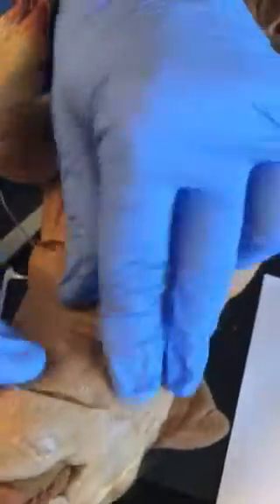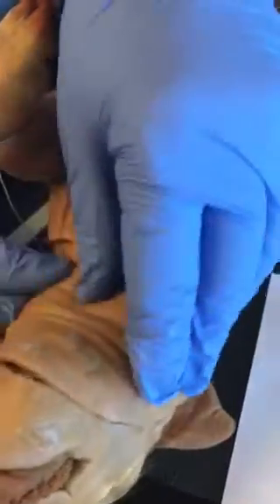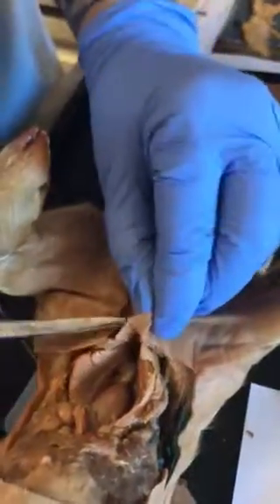And I wasn't clear if this piece of tissue was supposed to be completely removed or just folded back, but either way we got to see the structures that we were looking for. Okay, so now we're going to remove the tissue, I believe like opening a door.